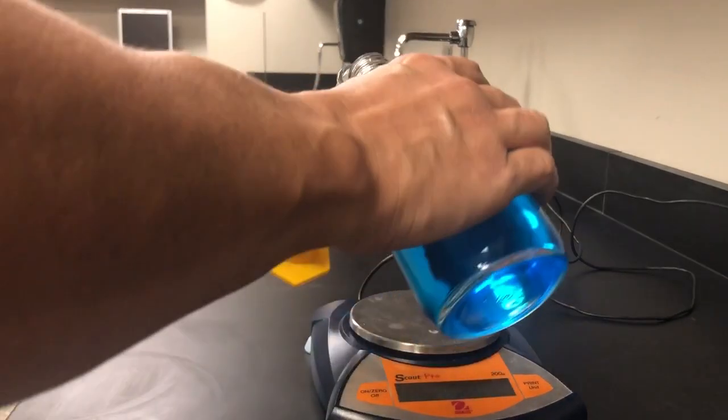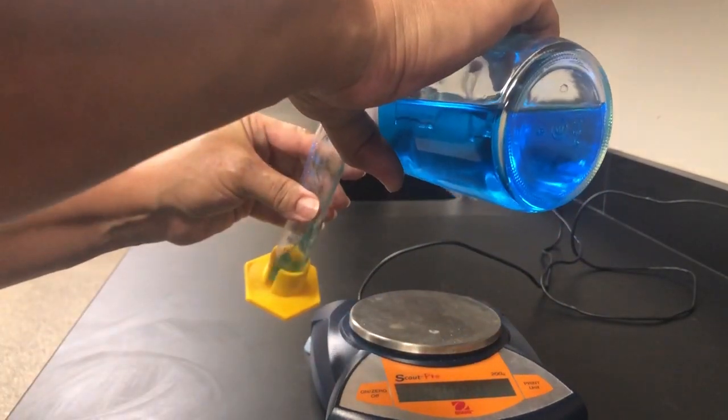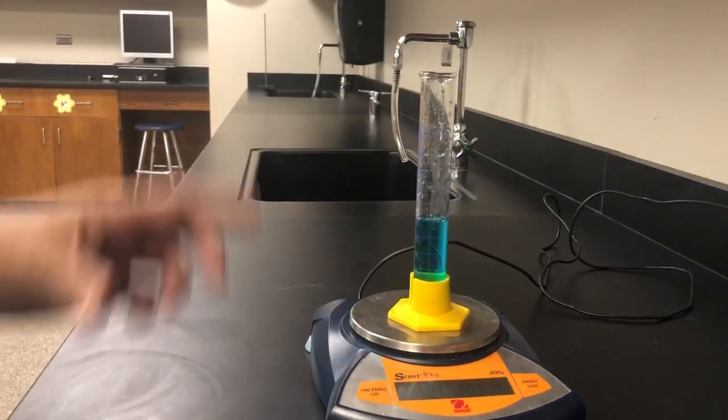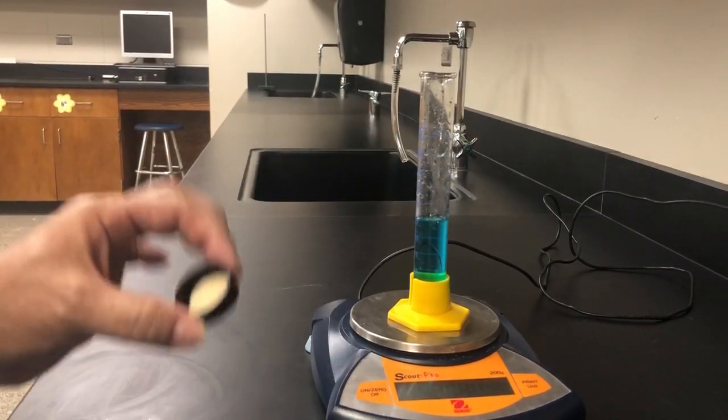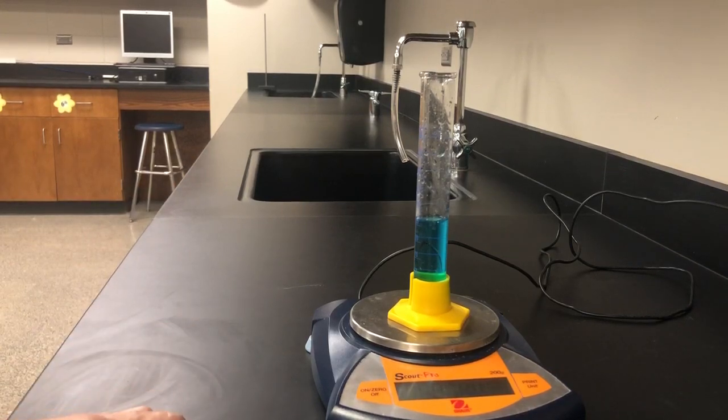I'm going to carefully pour some solution in here, put it back on the electronic balance, and put my lid back on. Did you notice I put the back of my reagent bottle down so I don't contaminate my solution?